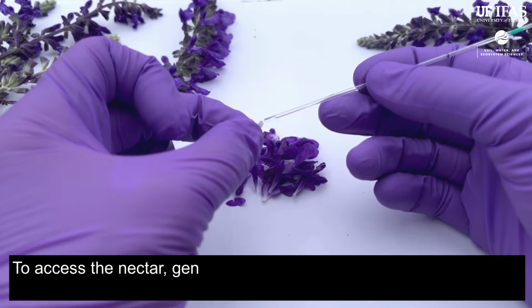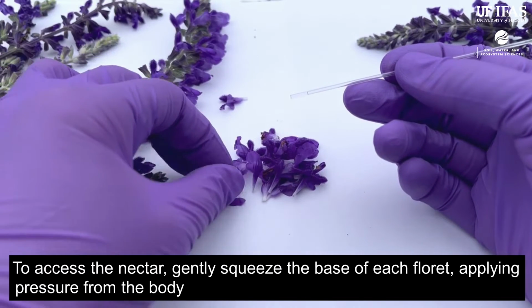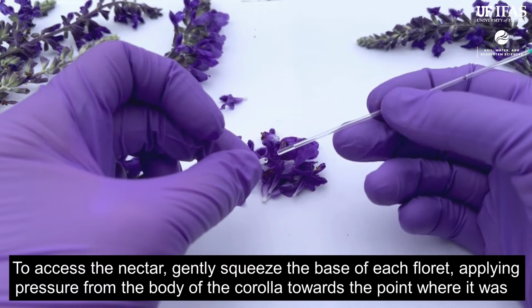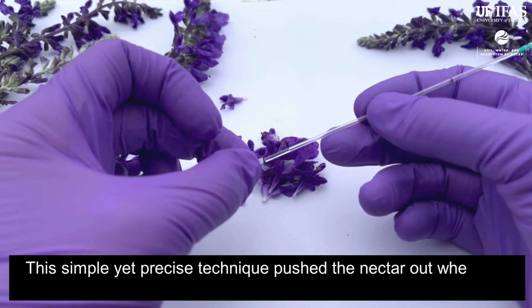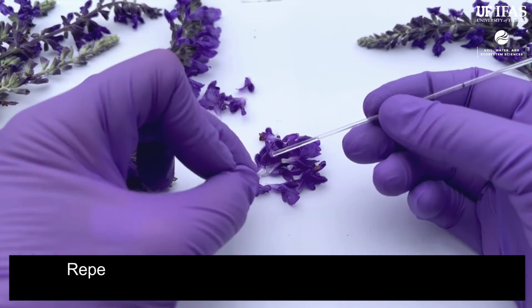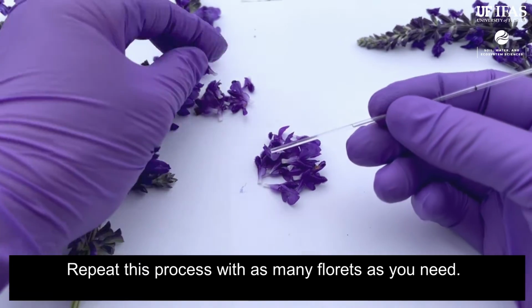To access the nectar, gently squeeze the base of each floret, applying pressure from the body of the corolla towards the point where it was attached to the spike. This simple yet precise technique pushes the nectar out where it's accessible for sampling. Repeat this process with as many florets as you need.